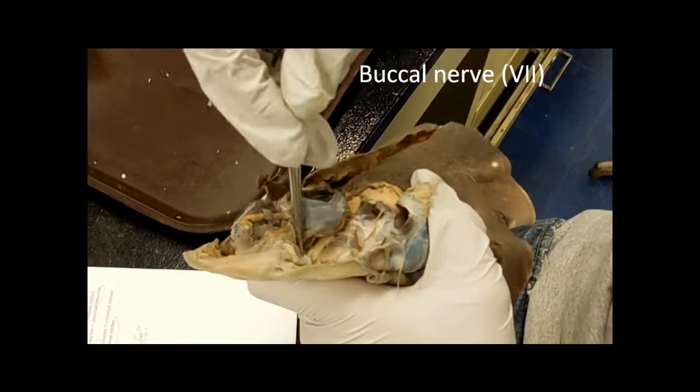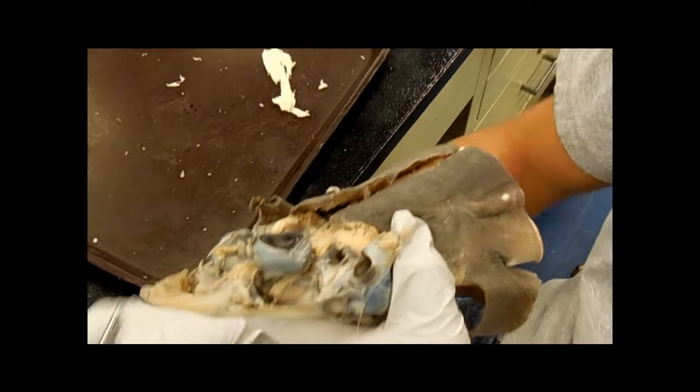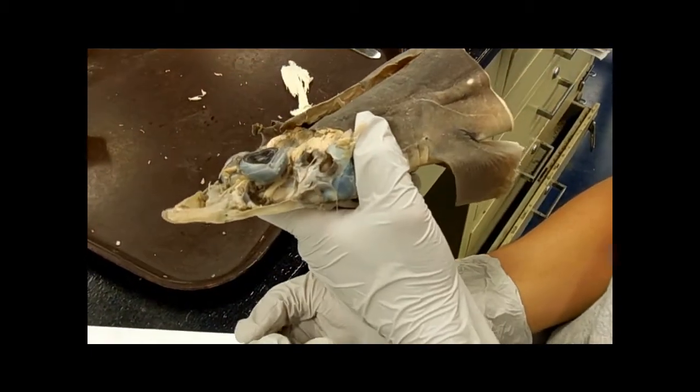And then the one that goes more downward, this one's the buccal nerve. Buccal. And I'm pretty sure that's all of it.